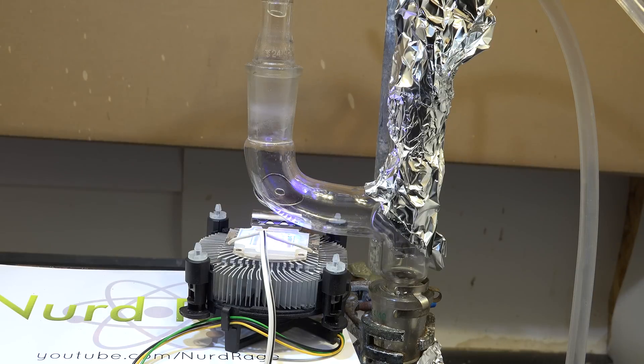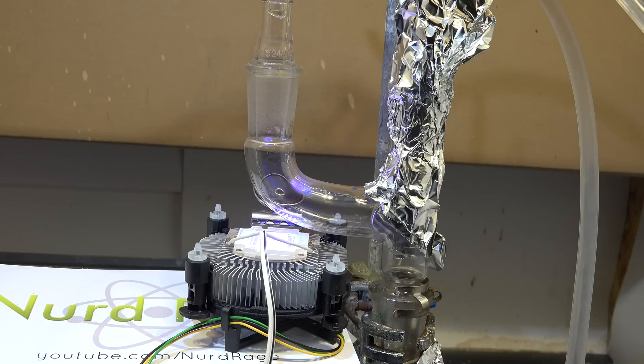Now turn on the UV light and start generating the chlorine, admitting it to the reaction. I have to apologize for the excessive and annoying number of flies you're going to see around the apparatus. They seem to be attracted to the UV light and clustering around it. I know it makes my lab look like a terrible third world ghetto. Totally unprofessional and amateurish. Okay moving on.